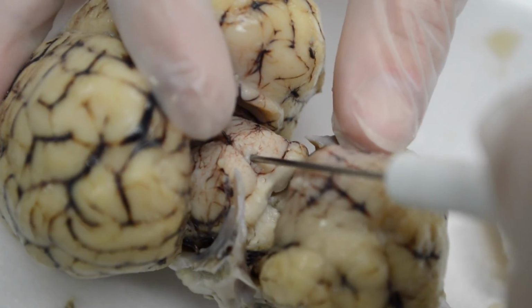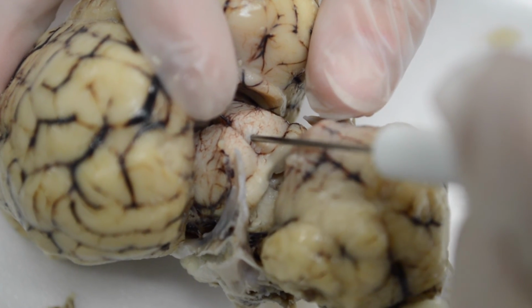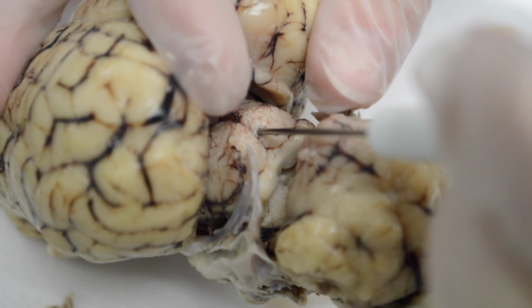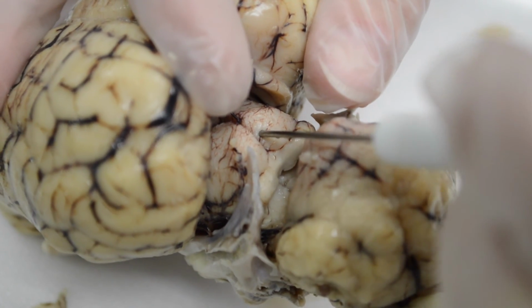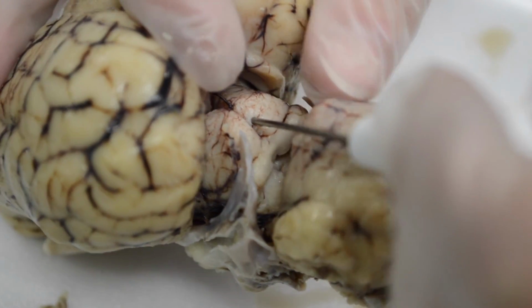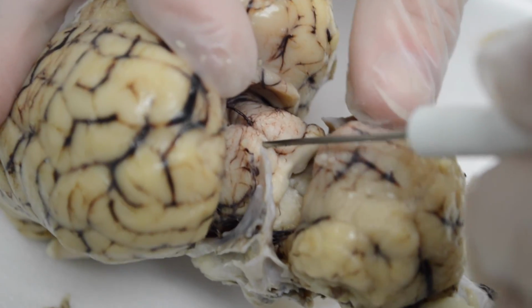Superior colliculi helps with tracking, so it has to do with vision, things that you see, either movable or immovable objects. So you're watching something move with your eyes, or your eyes are moving across a page as you're reading a sentence. It is the superior colliculi that help with that visual tracking.